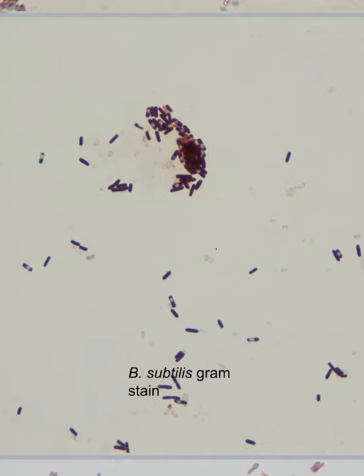So I suspect some of these smudges here, these are spores that you can just kind of barely make out. They've taken up a little bit of dye. You would probably miss that this organism was a spore former unless you could see a few cells with an unstained spot in the center of them. Again, the spore is not taking up the dye, so you see a little spot in there that's unstained. Okay, so purple rods, remember, these are gram positive.